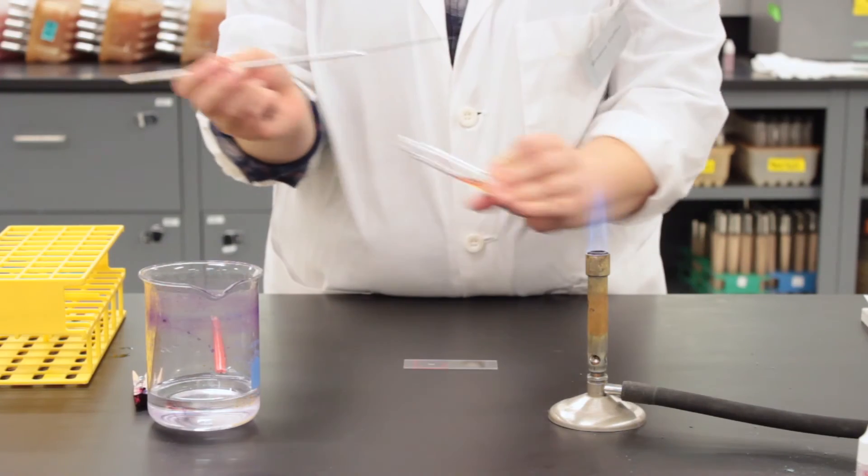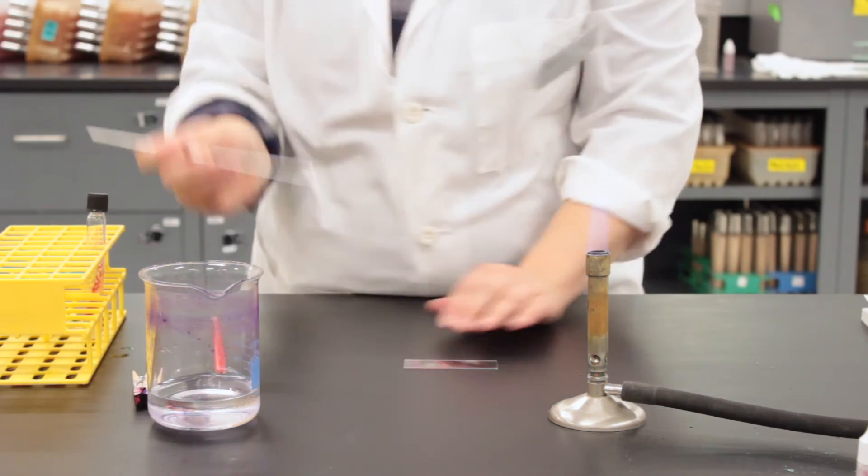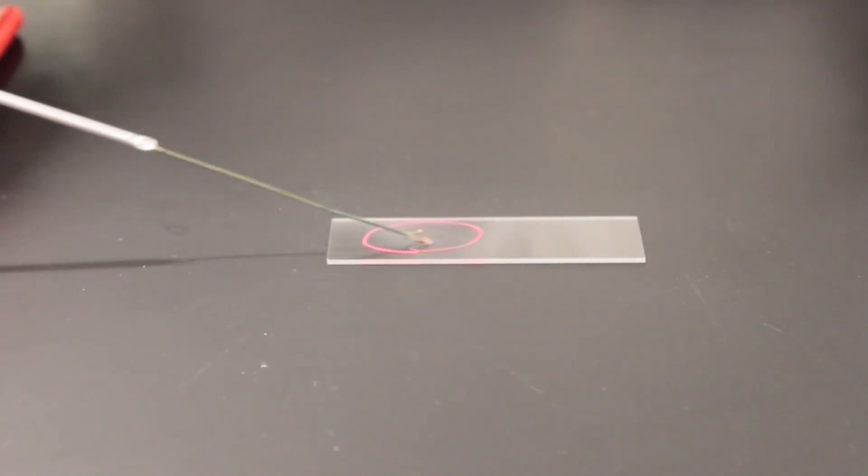Make sure to use aseptic techniques. With the bacteria on your loop, you will go to that water spot and we will mix it in.